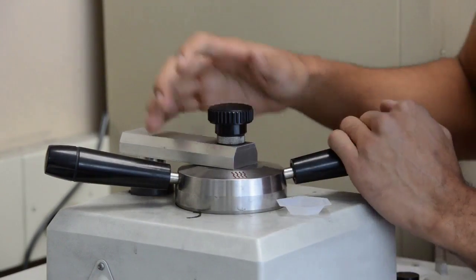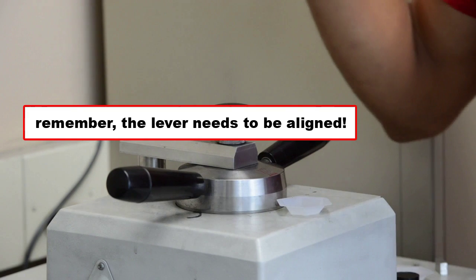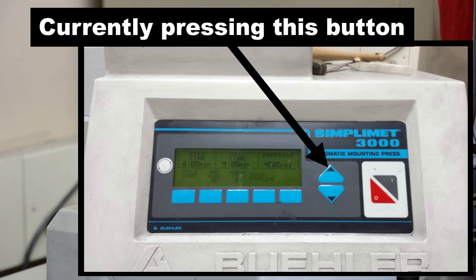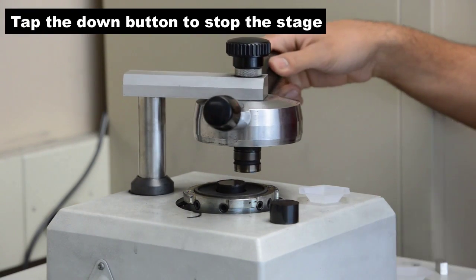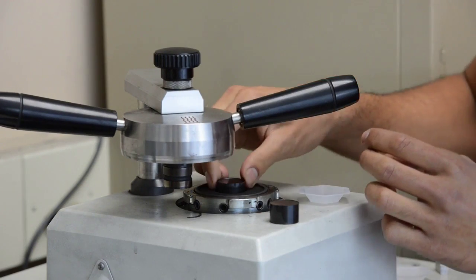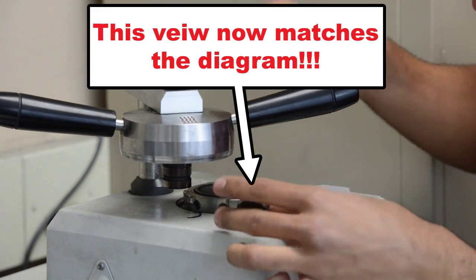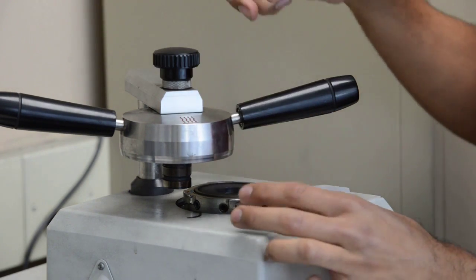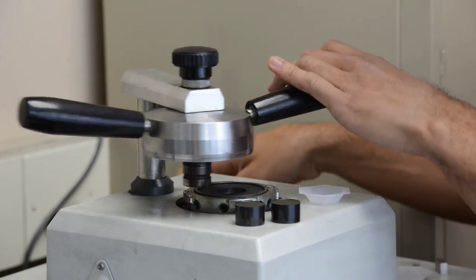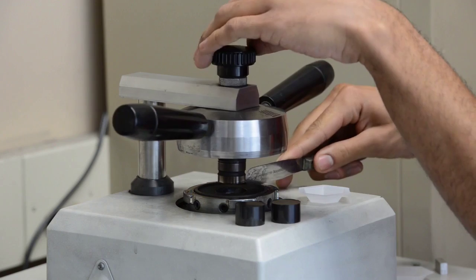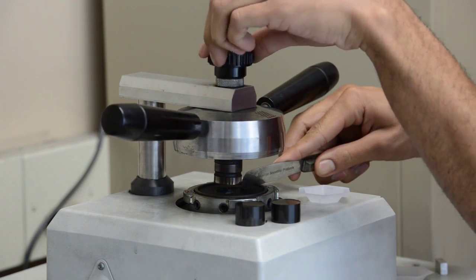So now this one's ready too. Taking it out. Here's the old one. And here's the new one. So this is puck number 39. I need to label them later on. And then the aluminum block. I don't need a dummy puck for the aluminum block because the aluminum block will just stand right there.